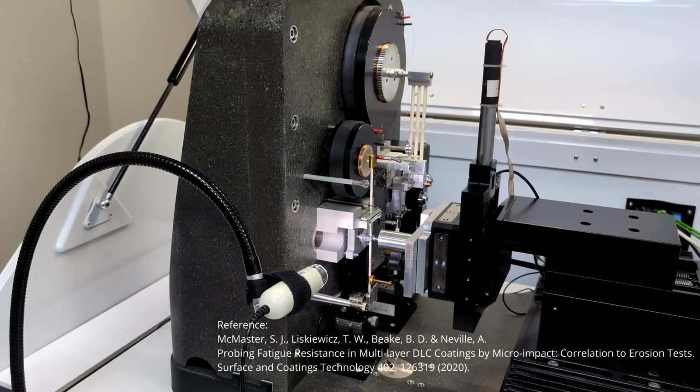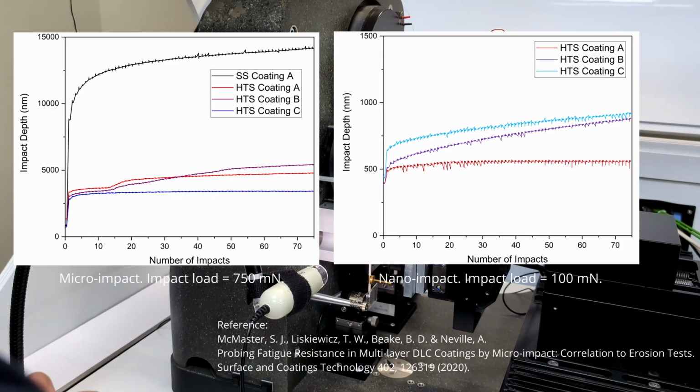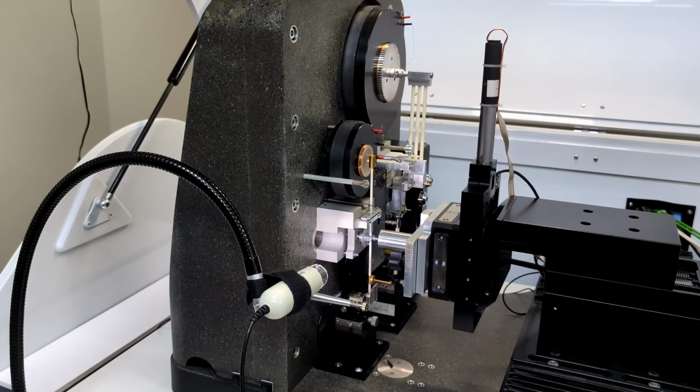This platform was used during my PhD studies to characterize DLC coatings with nanomechanics to inform on their tribological performance. I specifically used the micro and nano impact modules to explore the fatigue resistance of DLC coatings and relate erosive wear performance as characterized by optical analysis. As mentioned before, this platform is extremely versatile and able to cater for multiple industries, applications, and different testing regimes.